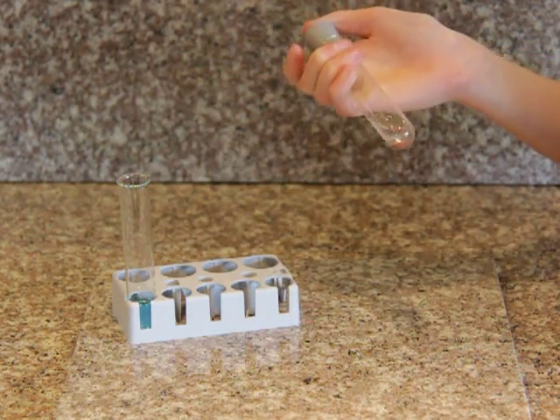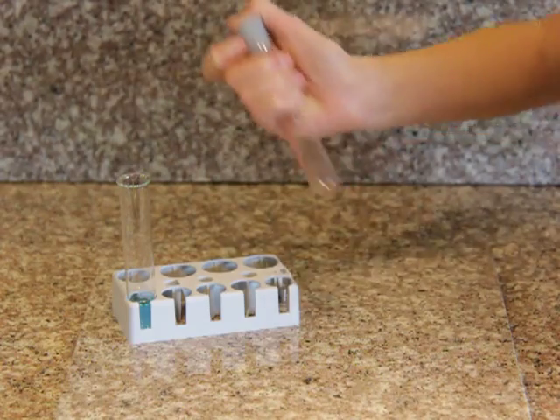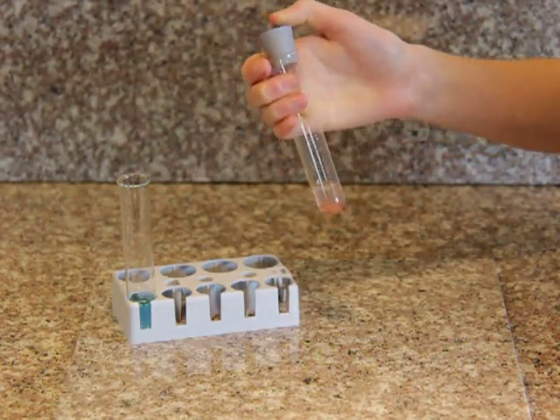And the iron filings are no longer iron colored. Ta-da!